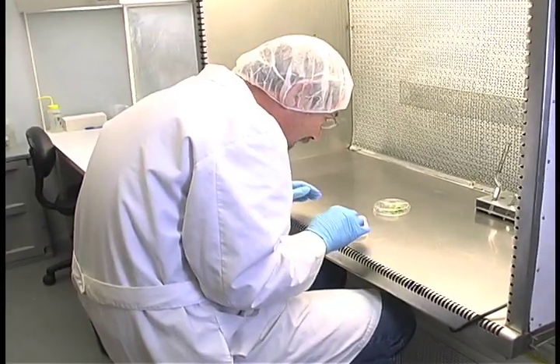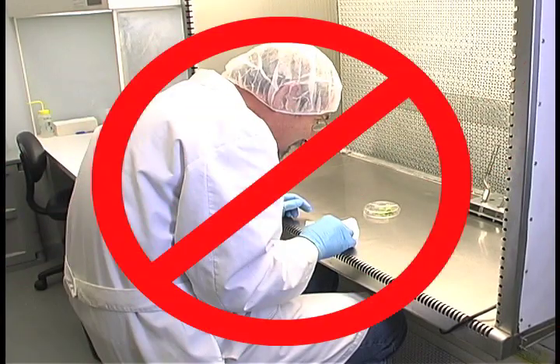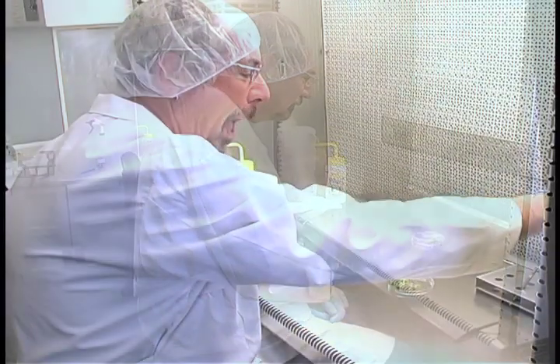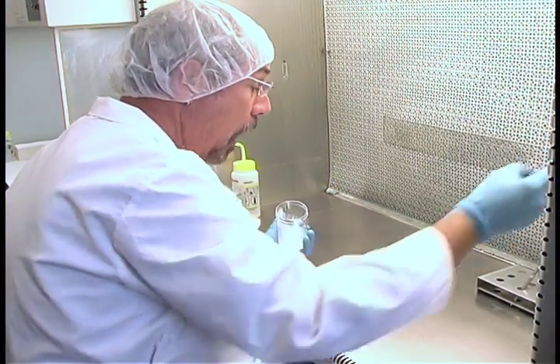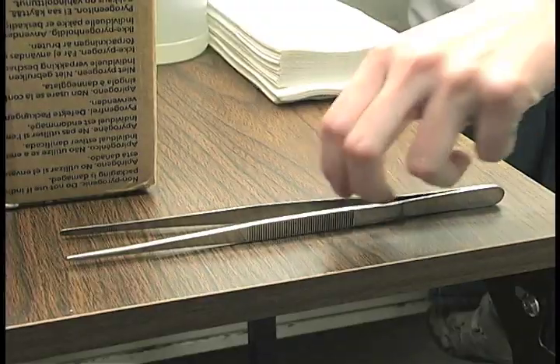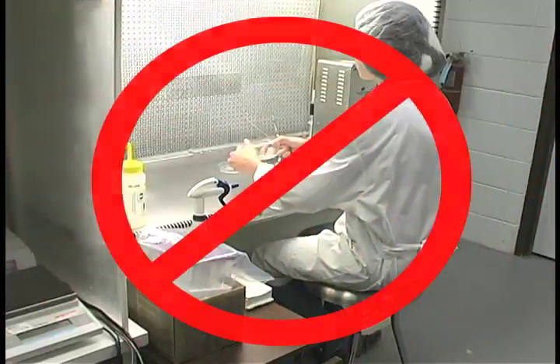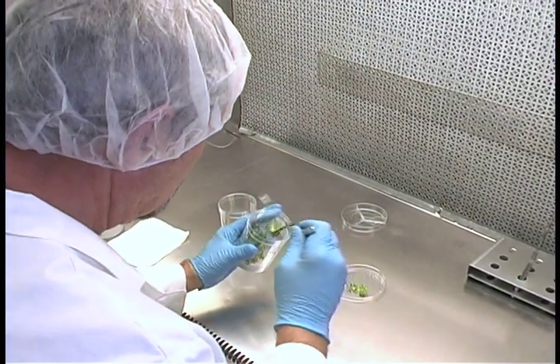Do not lean over the work area. Keep your back against the backrest of your chair and try to work with your arms straight. This position may feel awkward, but it will reduce contamination. Talking or sneezing while culture material is exposed can also lead to contamination. Do not pass non-sterile items over sterile areas or items — reach around rather than over. Make your movements smooth so that you do not disturb the air more than is necessary.